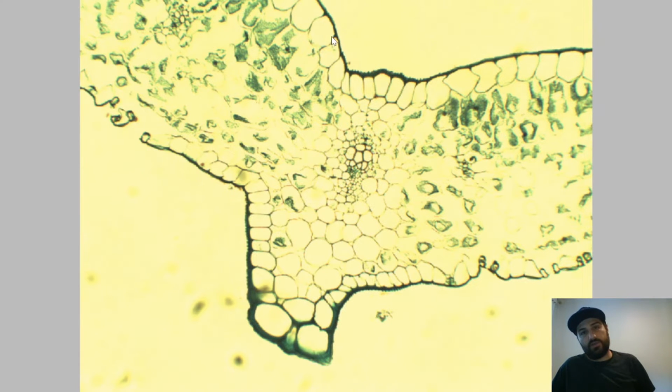So then you've also got our epidermis layer here, lower epidermis layer, upper epidermis. Maybe you're seeing slight changes there in the size of the cells, but that could be just partly on this part of the slide. Then you've got our photosynthetic cells. You can see these are the greener ones that actually have the chloroplasts contained in them. So now we've got these chloroplast containing cells, the palisade cells, densely packed together, stacked quite evenly along each other.